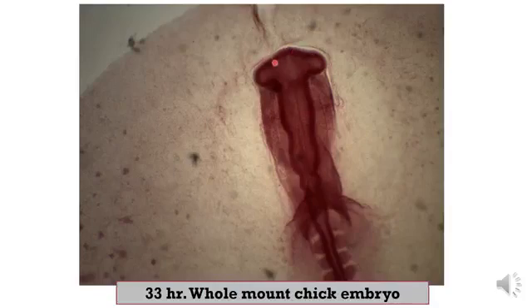Here you can see the brain vesicles, and the opening of the neural tube anteriorly is called the anterior neuropore. Anterior neuropore. You can see this region, which is an opening, we call the anterior neuropore.